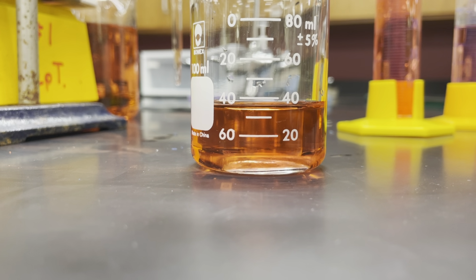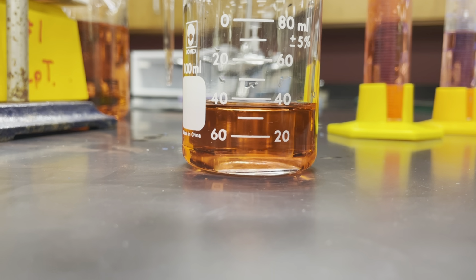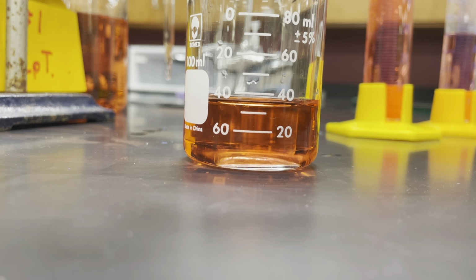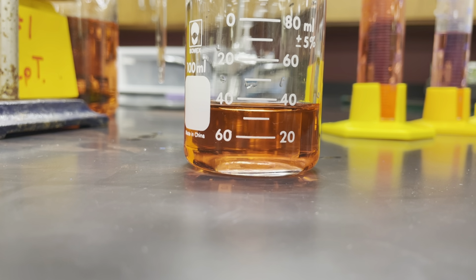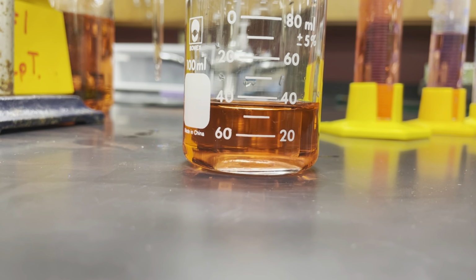And we can't claim to know that either, no matter how good your eyes are. We can't add marks to the beaker and say, I'm just using this here. Well, that's not how the glassware is calibrated. So the best we can do is say this is something between 30 and 40 milliliters. Now, we don't usually just say somewhere between 30 and 40.